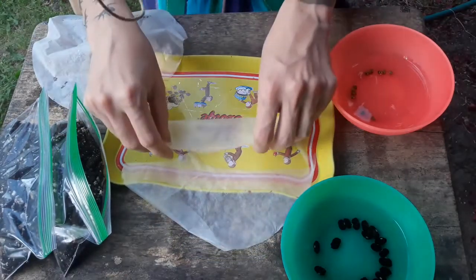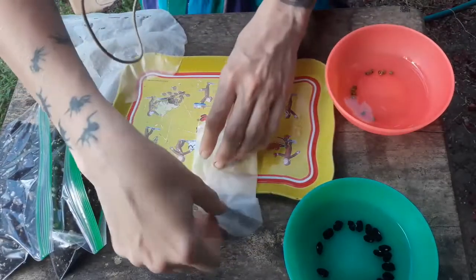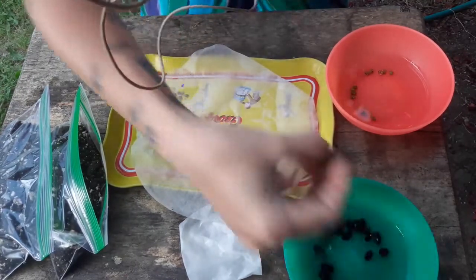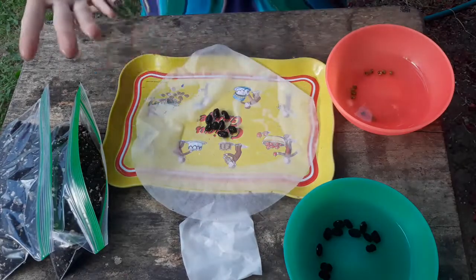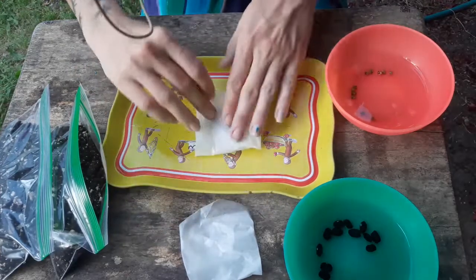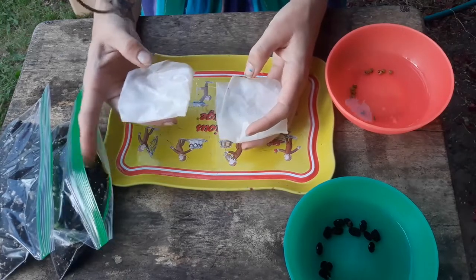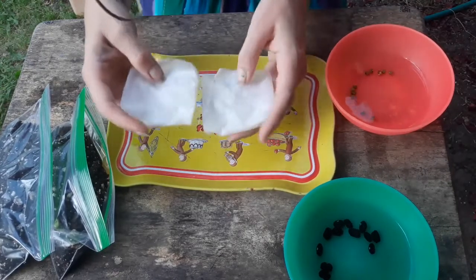Fold the filter paper so it stays like a little envelope — just fold up, then over, then over, then down. Take this and put it in a ziplock baggie for a couple of days, checking every single day to see how many have germinated. For our purposes, germination is defined by having a little radicle stick out. Put both envelopes in ziplock baggies and stick them somewhere with indirect light — keep the bag mostly closed so it stays nice and humid inside.